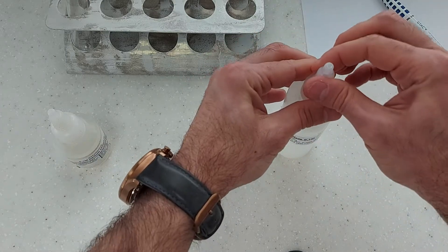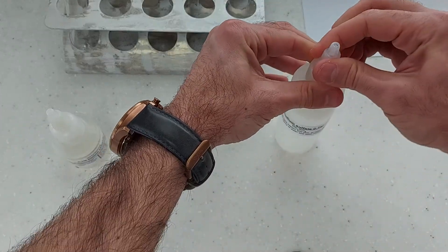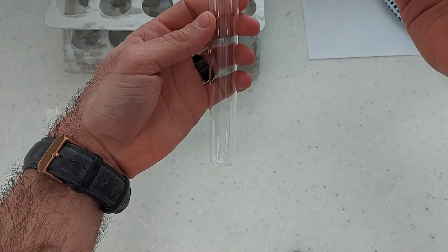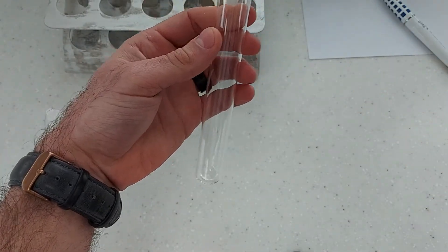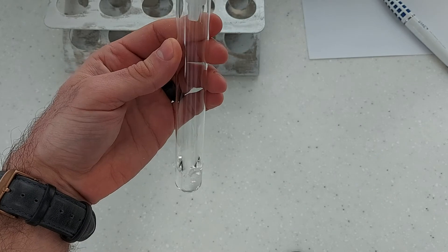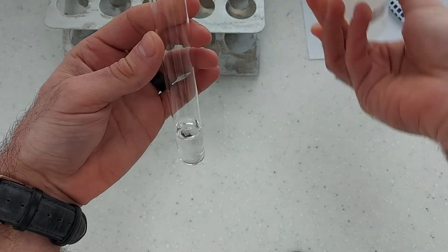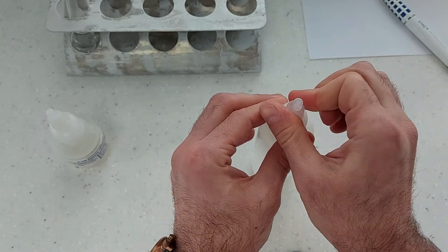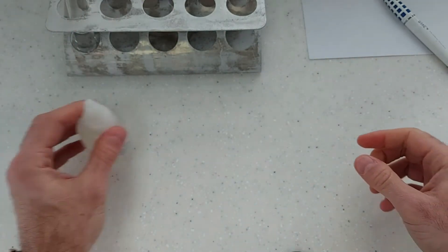Okay so I'll open the bottle for my sodium sulfate. Put a little bit in here. Close the bottle and of course I'm going to wash my hands after I do this.